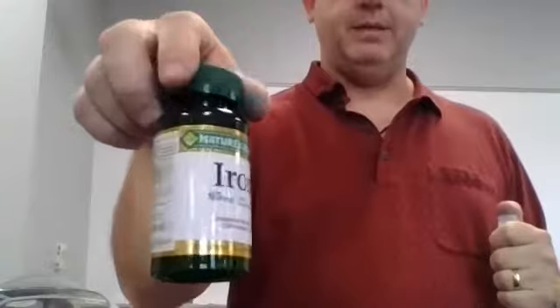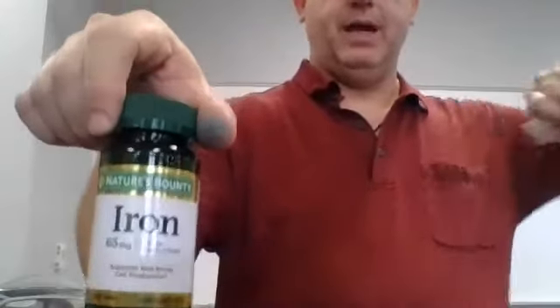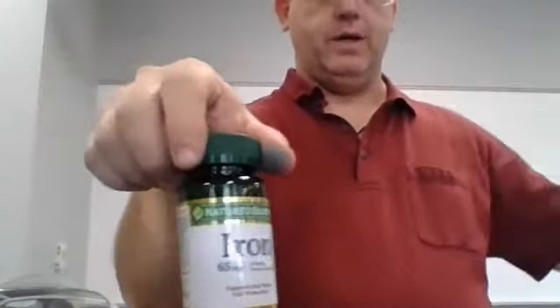Cover that well, and I'm going to invert it a bunch of times. Now, as I am doing this, I'm also going to be talking about the next thing that we're going to be doing. Remember at the beginning of the semester, we took iron tablets, 65 milligram iron tablets, and we determined the iron content of them. We're going to repeat that with this lab, but we're going to do it a little bit differently. We're going to do it using atomic absorption spectroscopy.